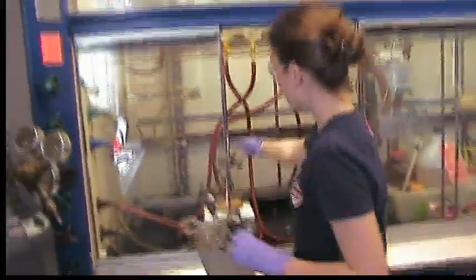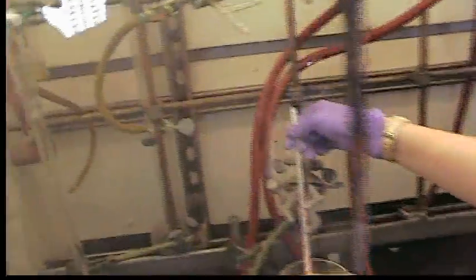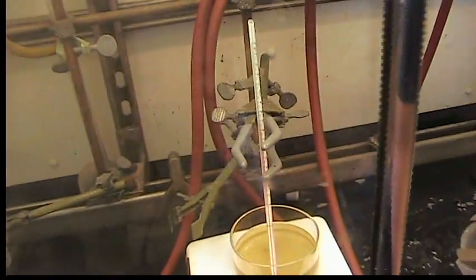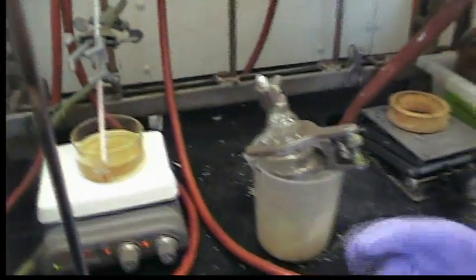You can have an oil bath that's preheated to about 65, actually 60 degrees, so you don't want to be too hot. Asp3 melts at 72, so you don't want to be above that temperature.